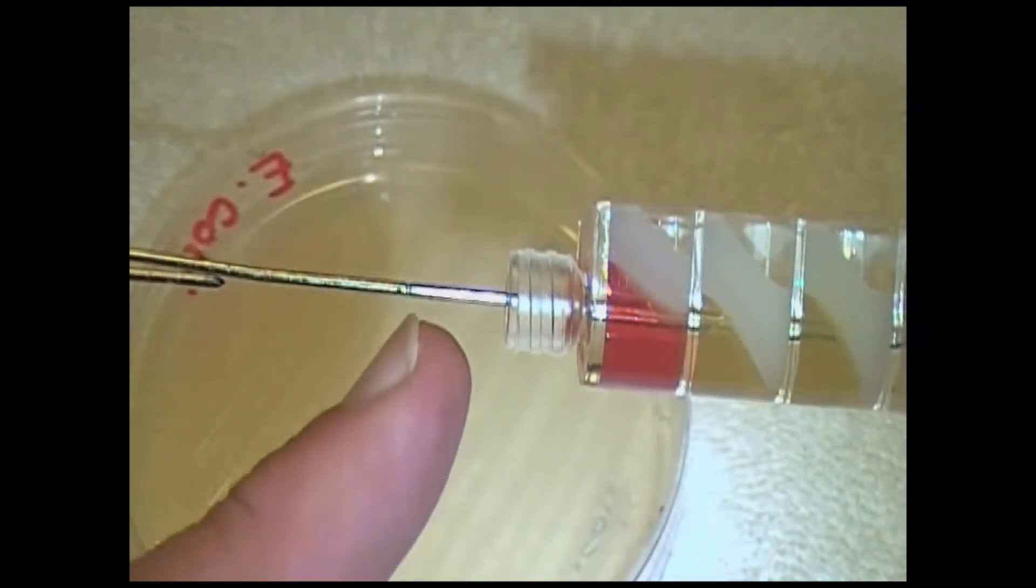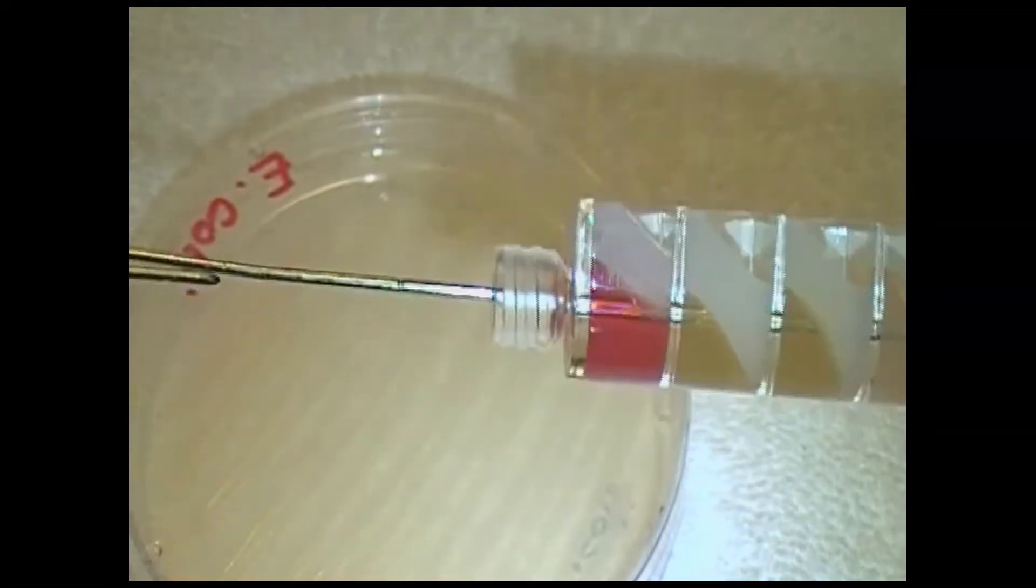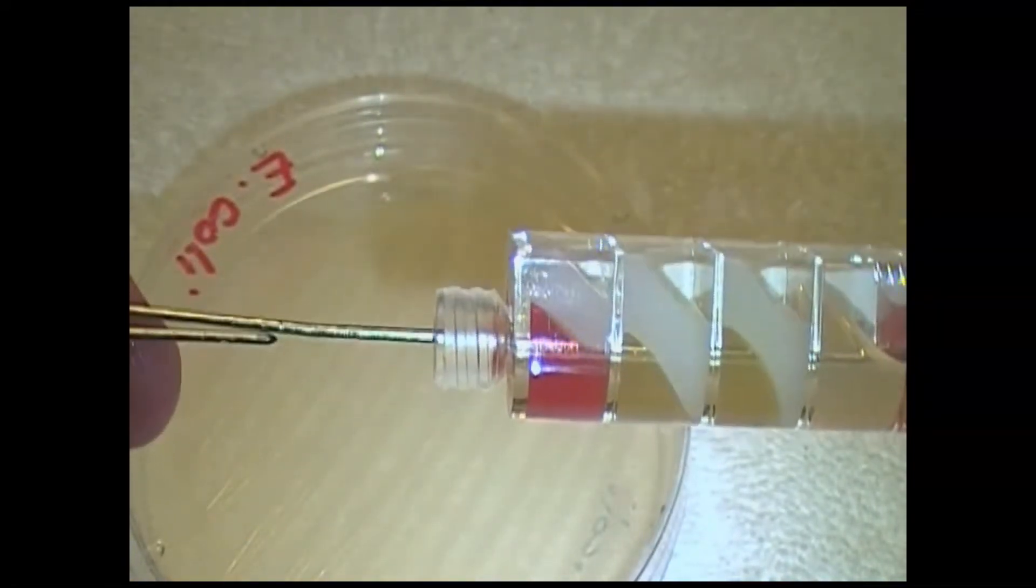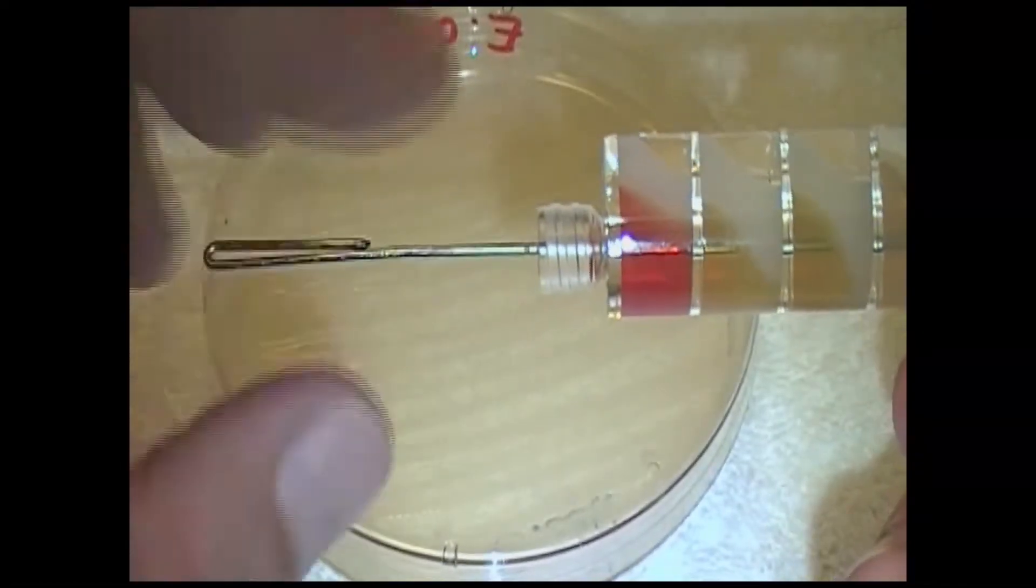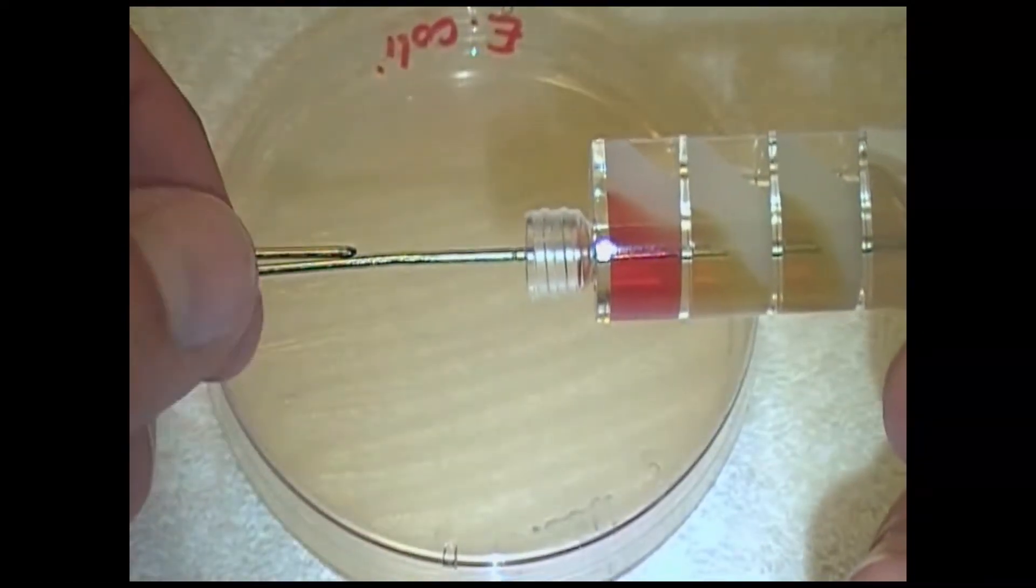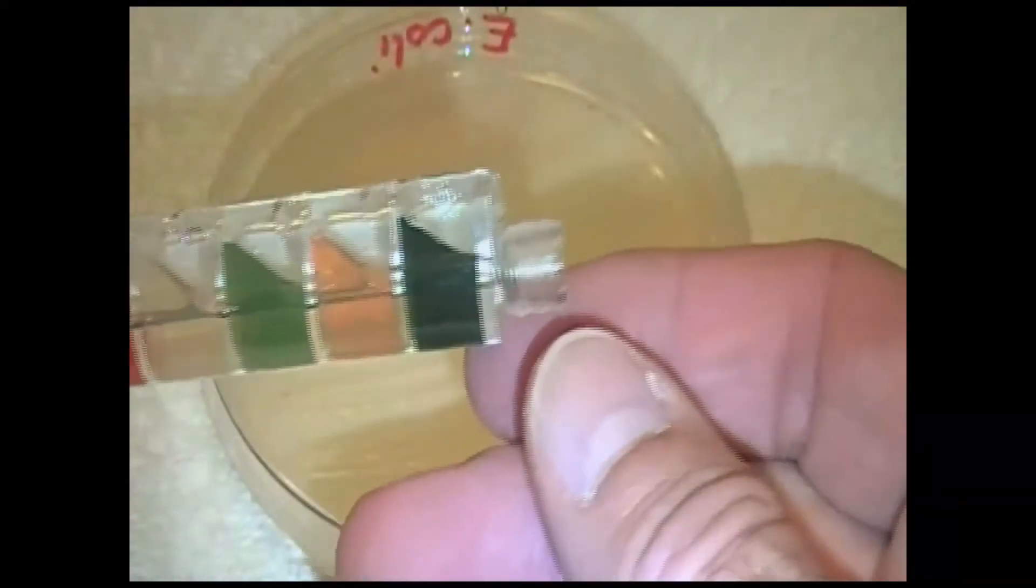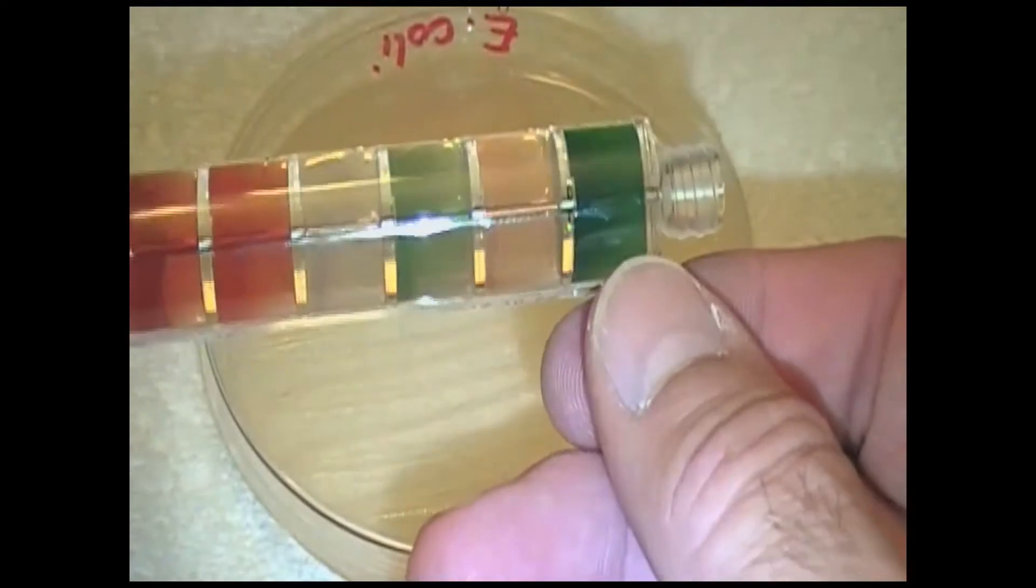The score is going to allow you to break off the needle. So we're going to push the score in like this to that spot. When you finish pushing it back in, you can see the little score over here. If we push that score right even with the end of the tube, you can come down here and see that the needle is no longer sticking out.